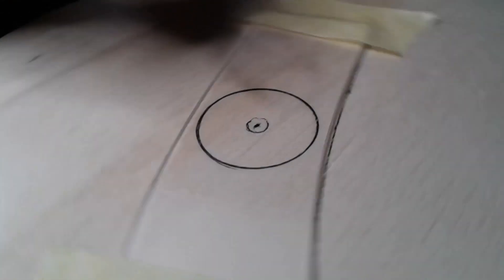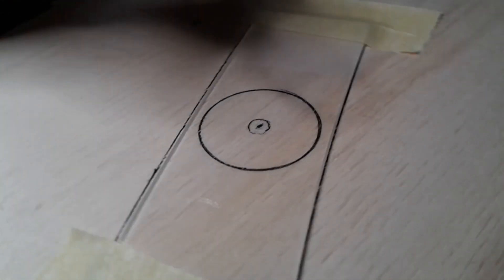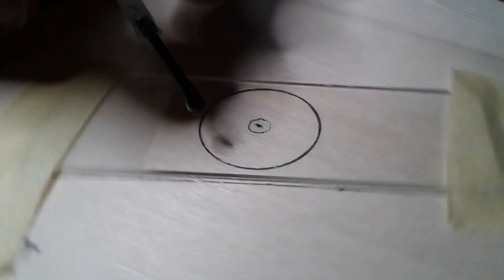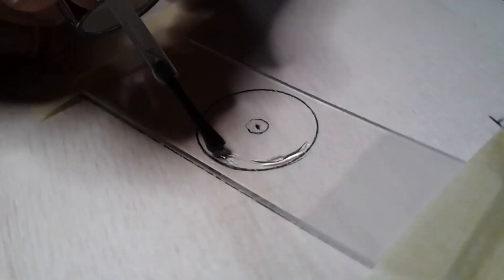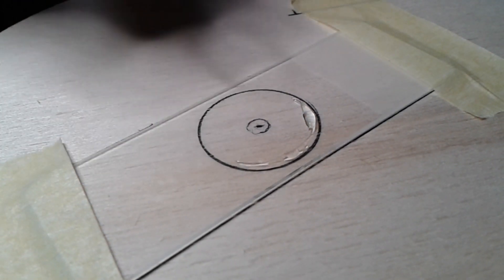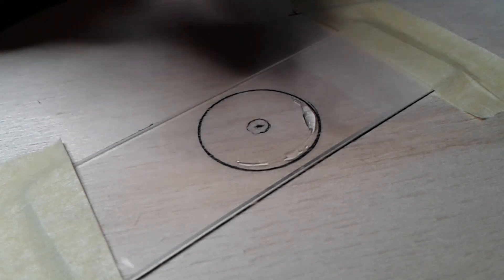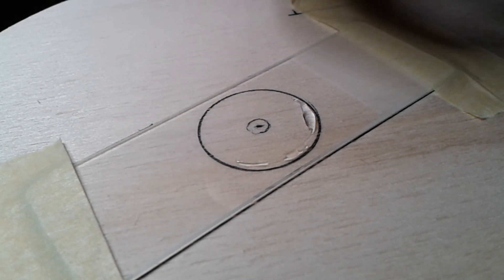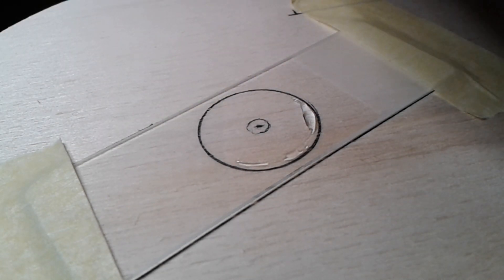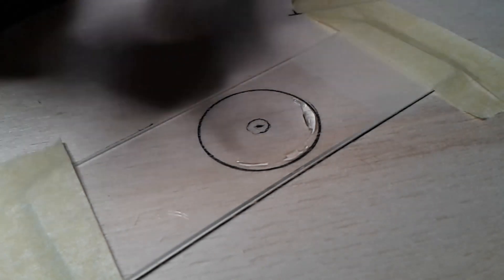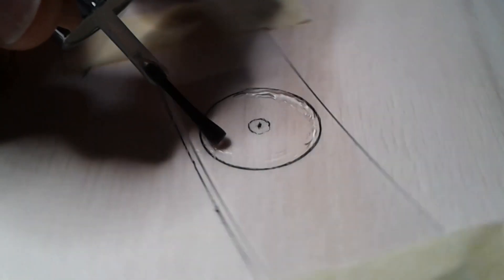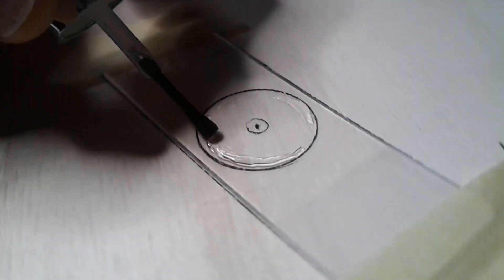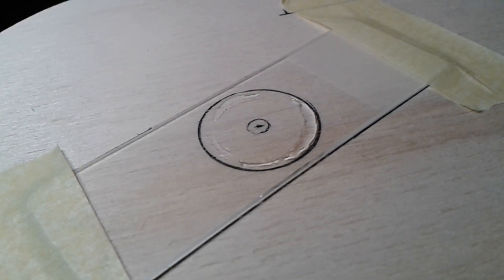The wobbly character of this slide ringing table is really a disadvantage. No, this is not going to work. The nail polish does not flow at all.